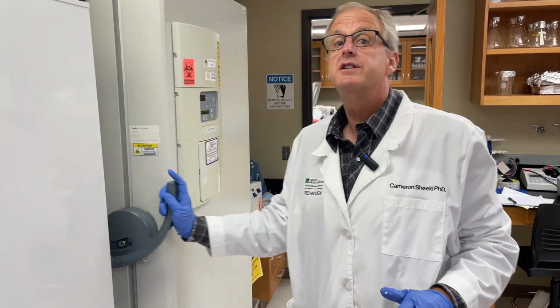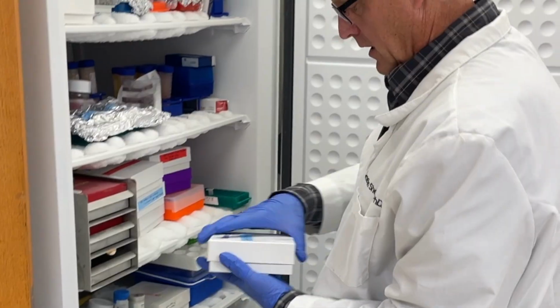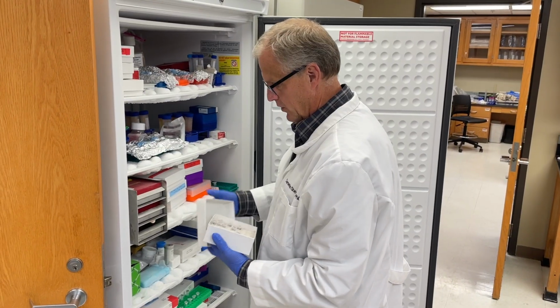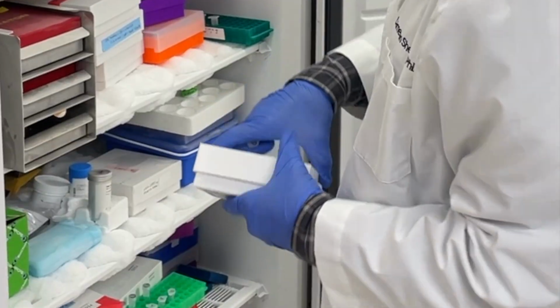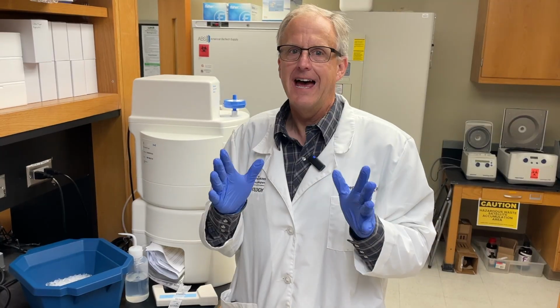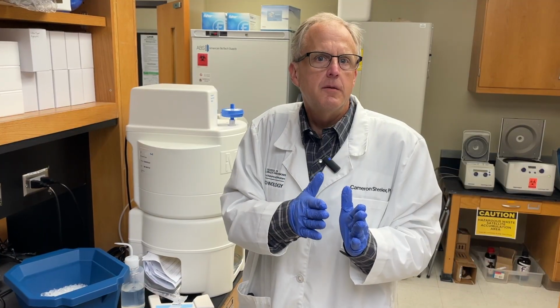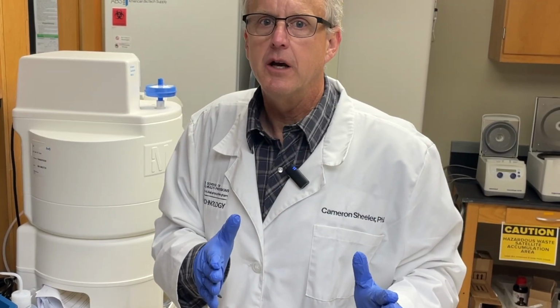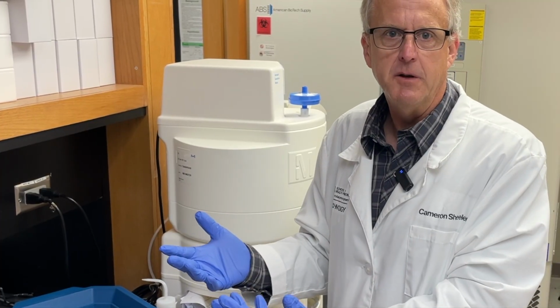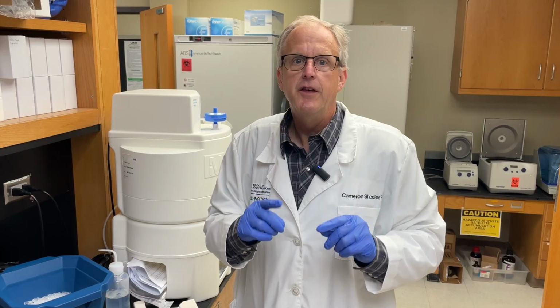And we have to get our second player, the plasmid. I have my frozen plasmid right here. And we'll put this on ice. The saga is ready to begin. Will the plasmid meet the bacteria? Will the bacteria embrace the plasmid? Will the plasmid go into the bacteria? This is today's saga. Let's find out how it ends.